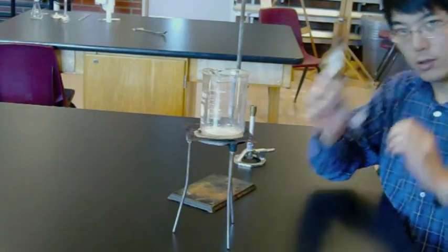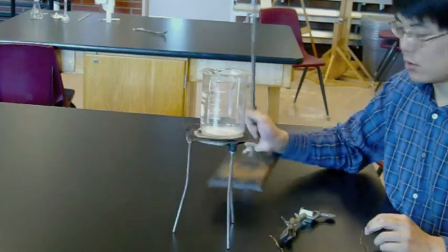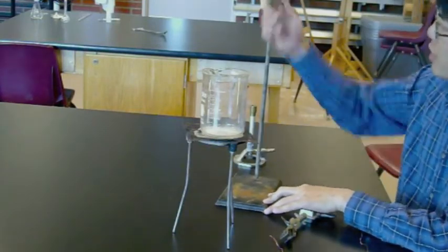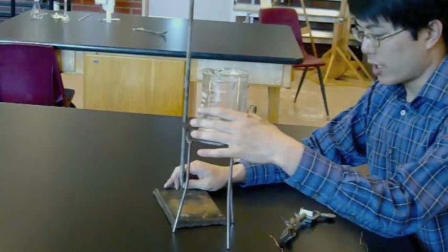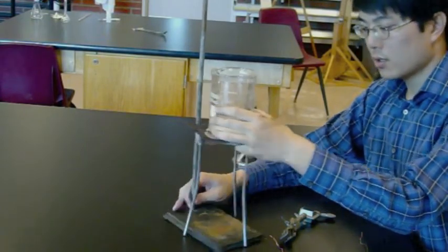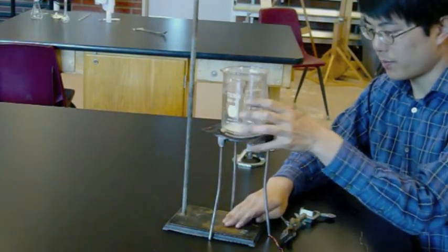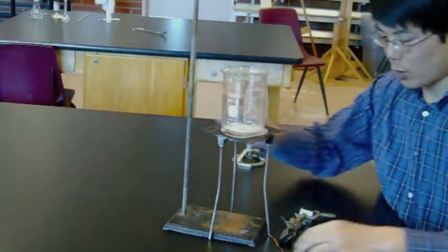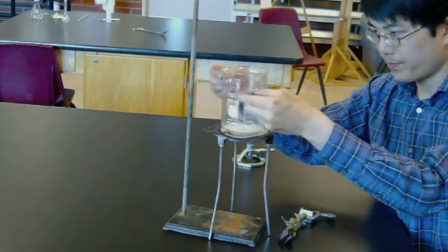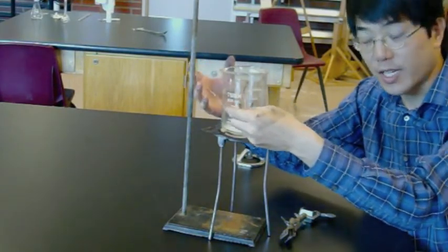That's where the copper wire and your accessory come in along with the laboratory stand. First of all, check the rod on the laboratory stand. Make sure it's screwed into the base tightly. And then put the laboratory stand underneath the tripod. Now you can see there's a bit of space right here. And what we're going to do is we're going to wrap a wire around the beaker. But obviously, if we have this gap here, then we're really not stabilizing anything.